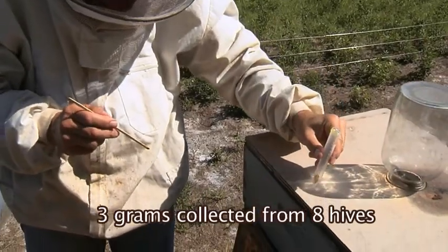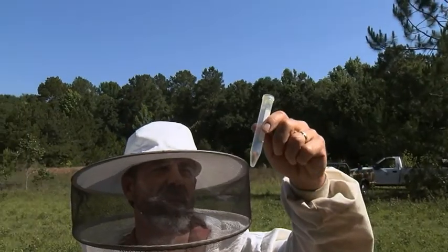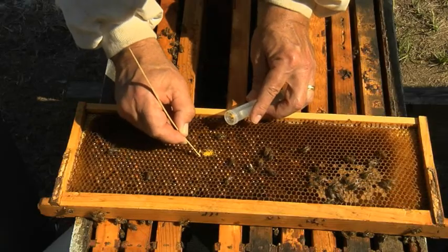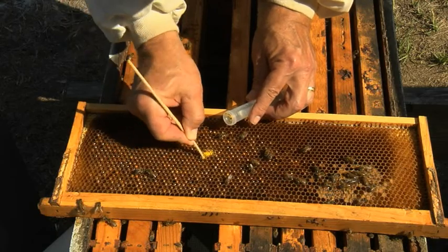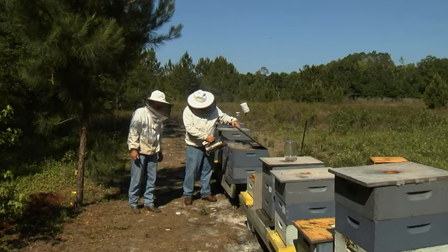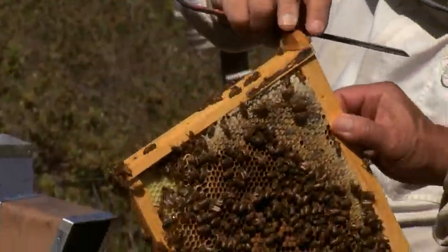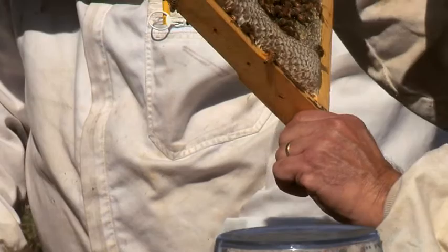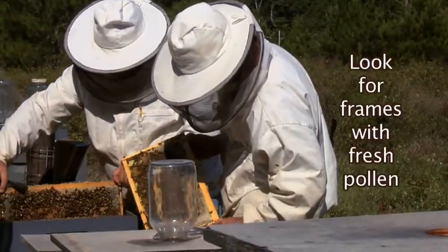A minimum of 3 grams of pollen must be collected from the 8 hives sampled within the apiary. To collect 3 grams, it is advised to sample 4 cells from each of the 8 hives. Now let's begin. After you have taken the honeybee sample from the brood area for the National Honeybee Pest and Disease Survey, look at the frames you have pulled to see if there are any cells with fresh pollen in them.